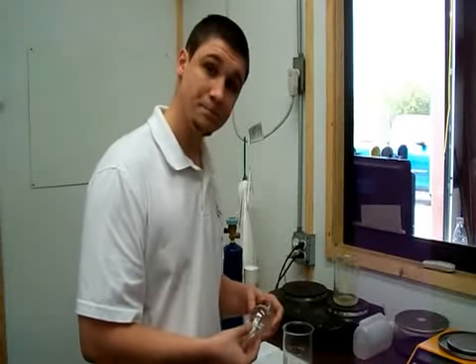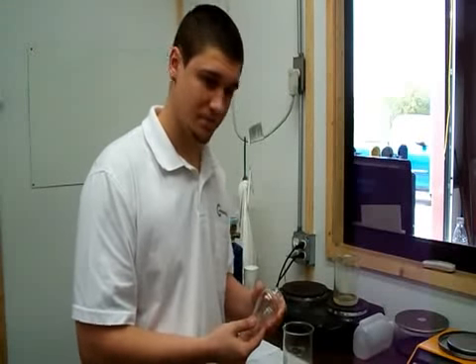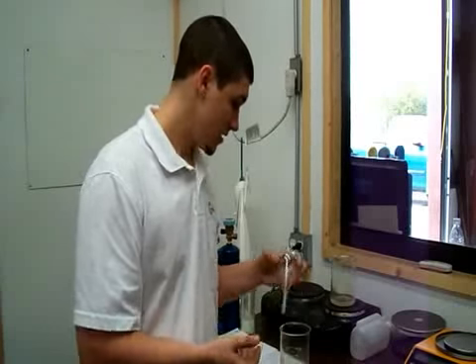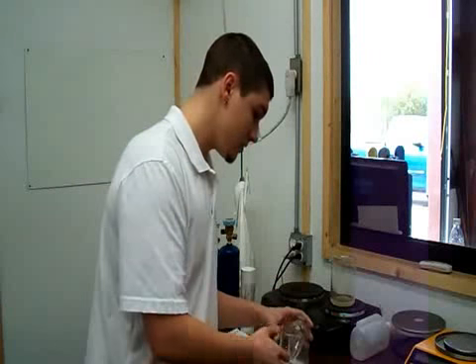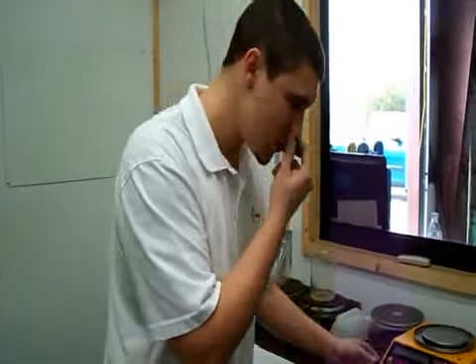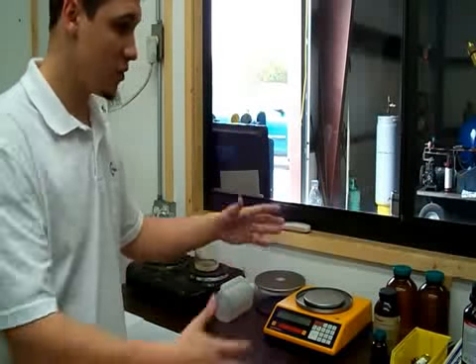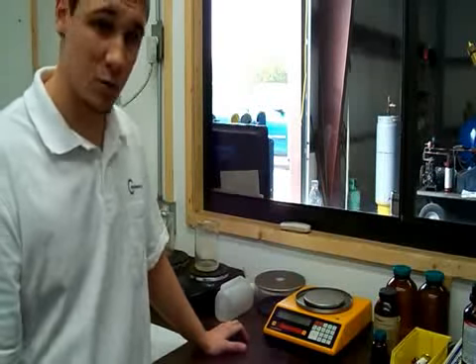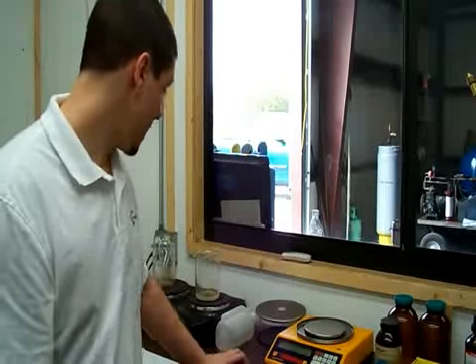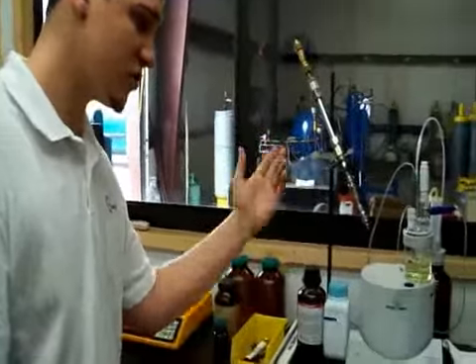I see. So that standard you're talking about is the ARI 700 standard? Is that what you're referring to? Yes. Okay. So what else do you have there? Now it tests for oil in the refrigerant. This is high boiling residue, yes, okay. So obviously this is a small scale which measures up to about 2,000 grams. It tells us basically our net refrigerants of all the samples we're running here, between oil and which we're moving on to now, which is a moisture sample.